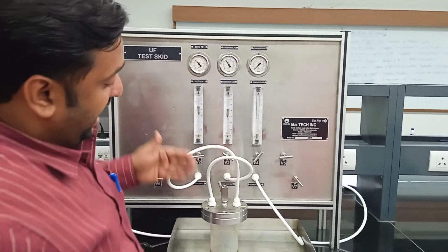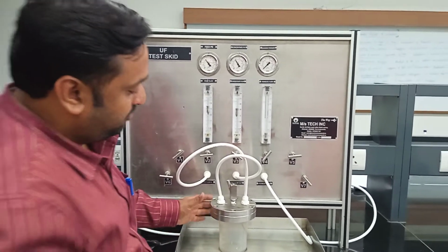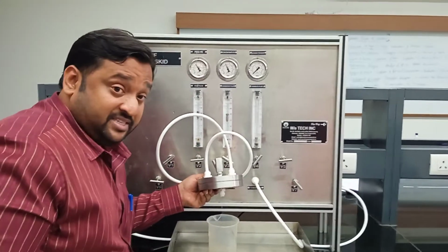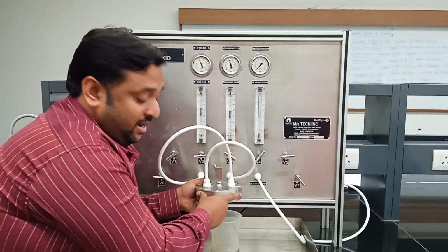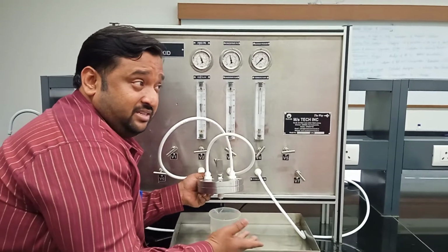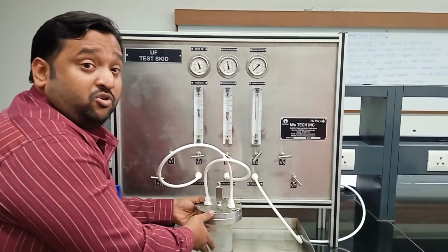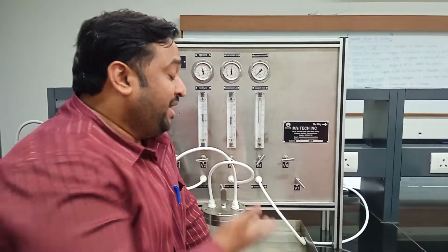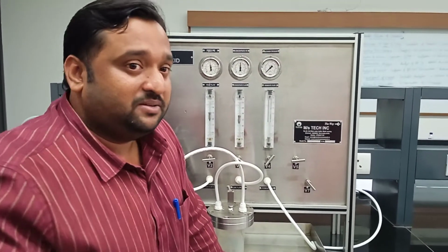centimeter square. I can see the permeate is getting collected at the bottom. So, John, you can see the dropwise collection of the permeate coming out of the cell, passing through the membrane. So you can note the time. Let us say, for example, to calculate the flux, the only thing you need to know is how much volume has come out within this time. Knowing the membrane area and everything, you can calculate the flux as well as the permeability.